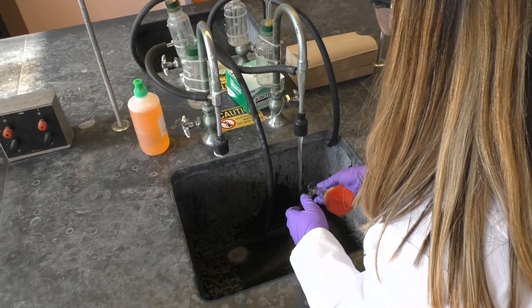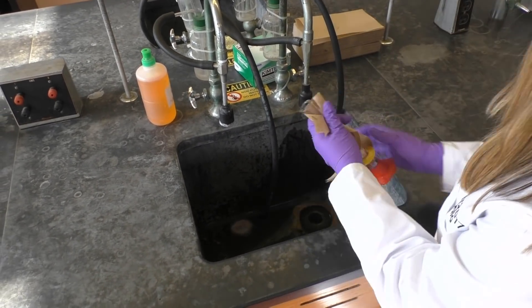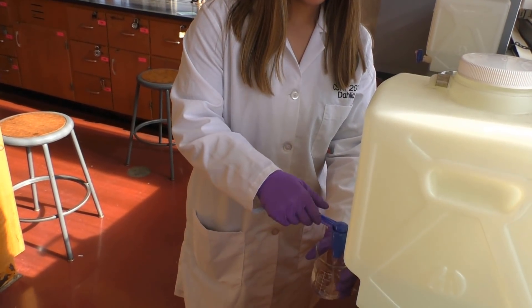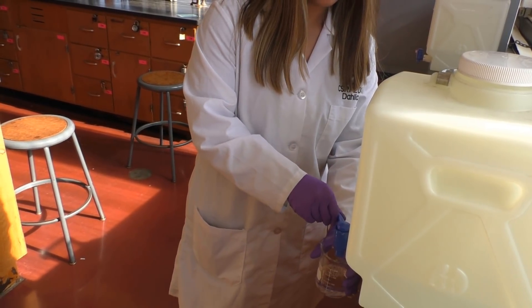You don't want your acid and base solutions to mix outside of the calorimeter, so be sure to rinse and dry your graduated cylinder after you use it every time. Now you need your acid, so again, obtain approximately 50 mL of HCl from the carboy into a beaker and then carefully measure out the correct amount.